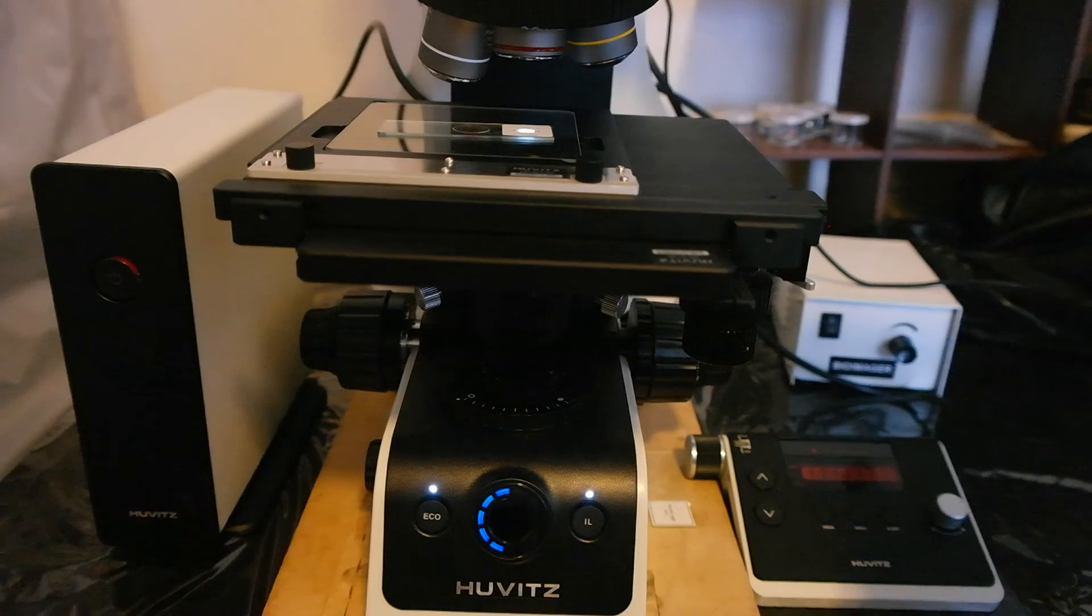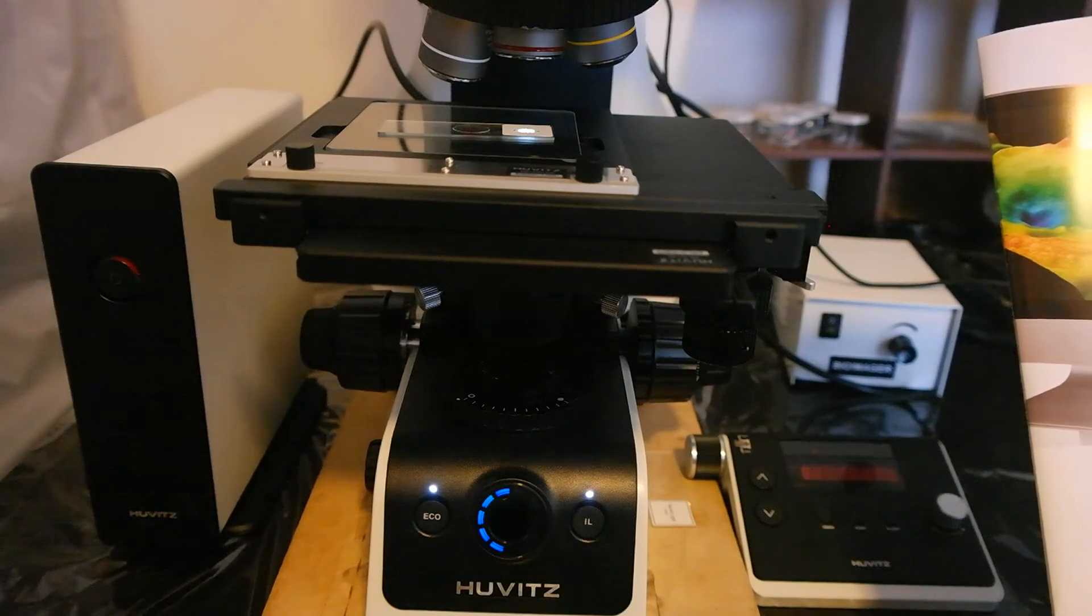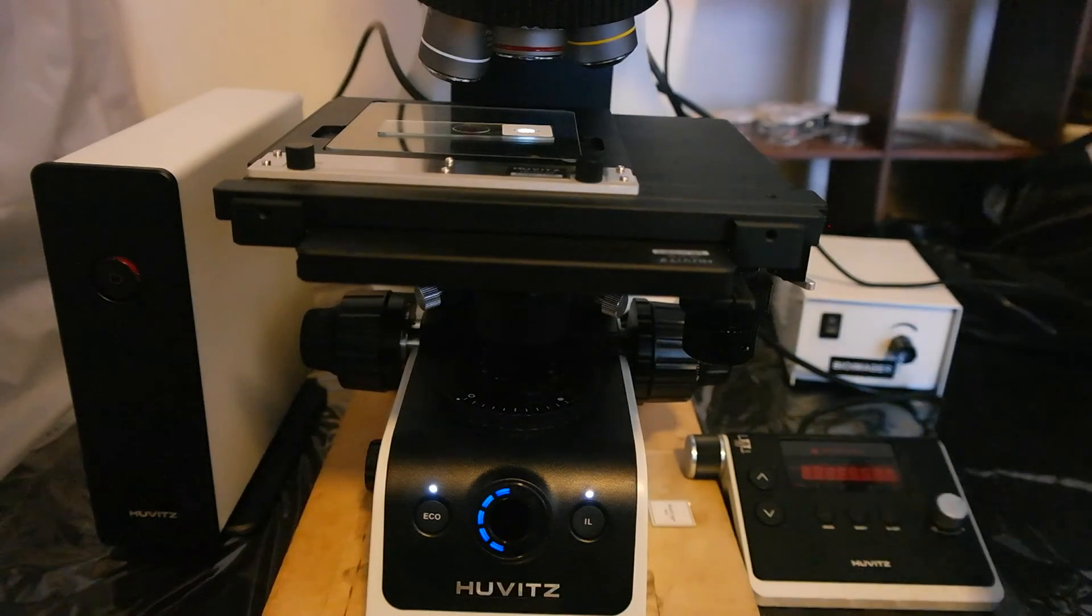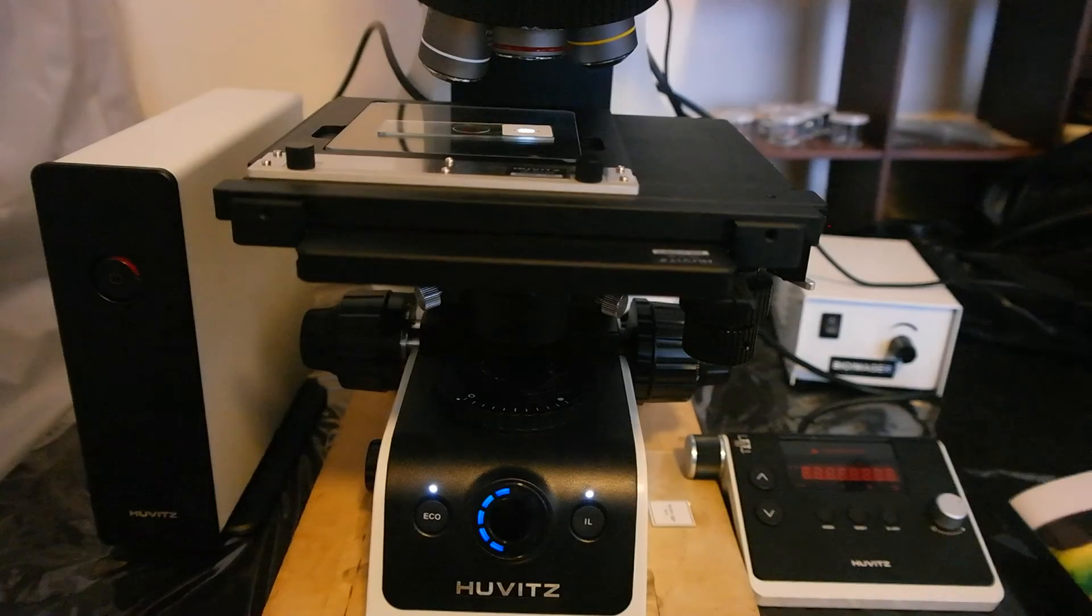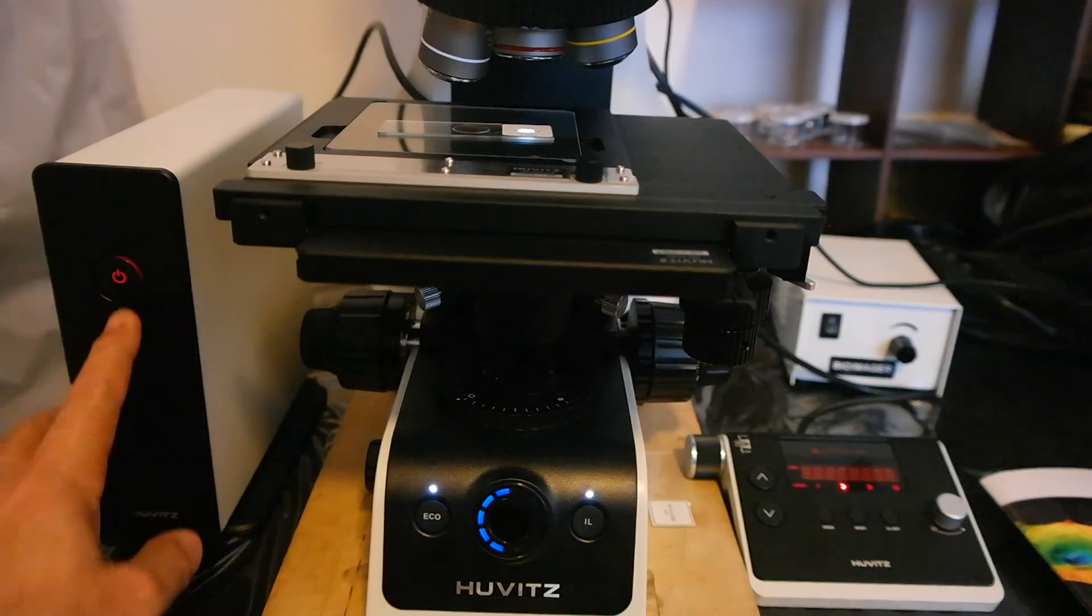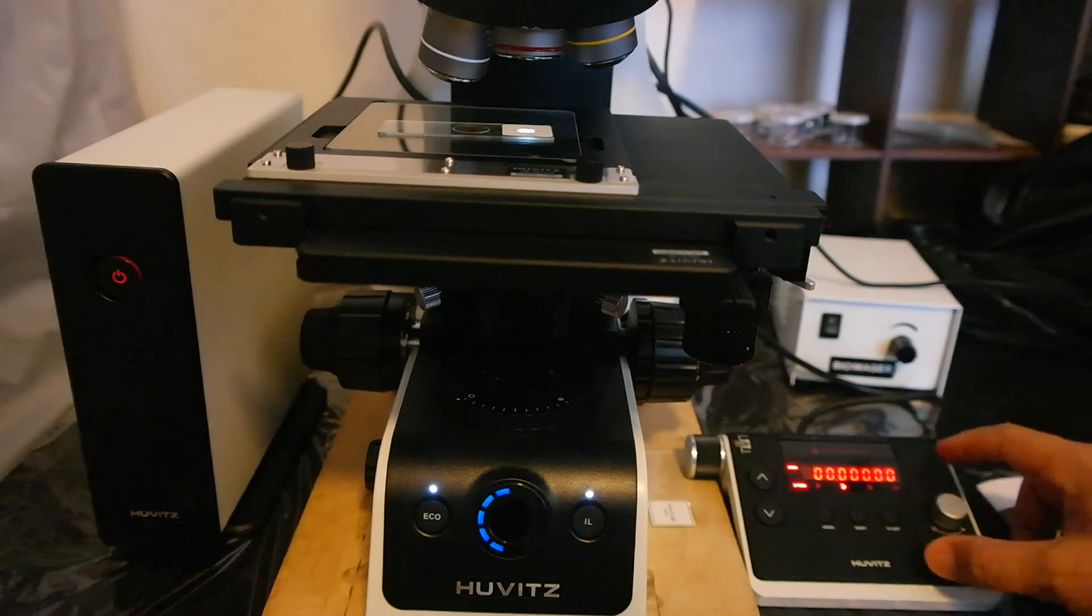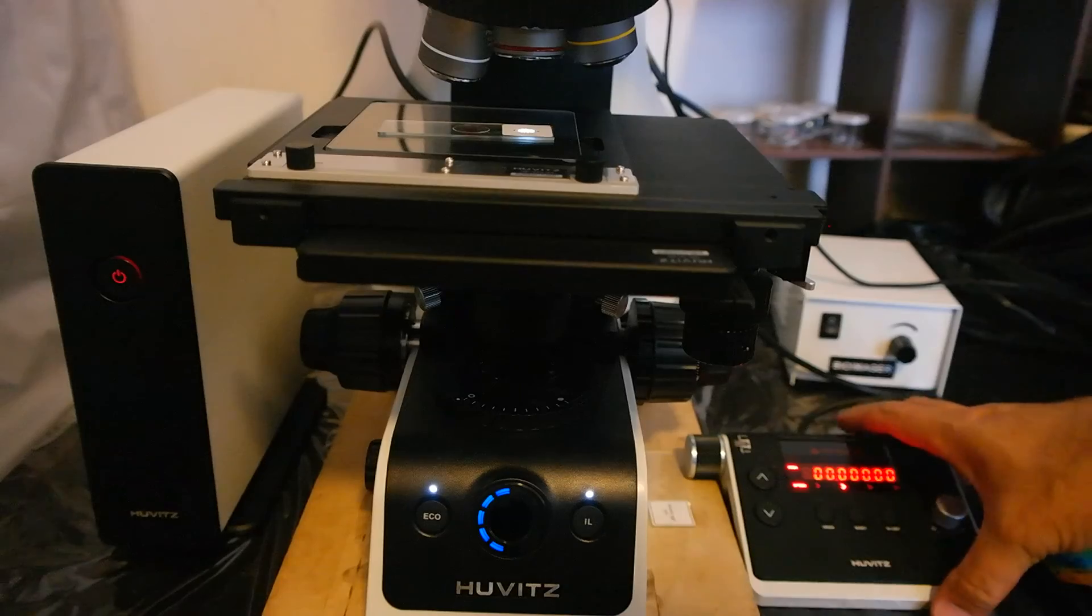And this Z profiler or 3D profiler has maximum speed of 1.4 millimeter per second and the loading capacity is 15 kg. So we use this box here to control the microscope and also we have this remote control pad.